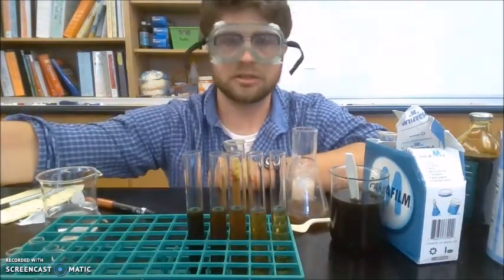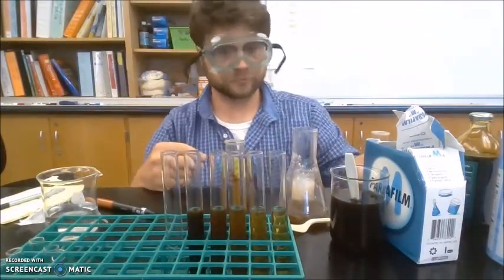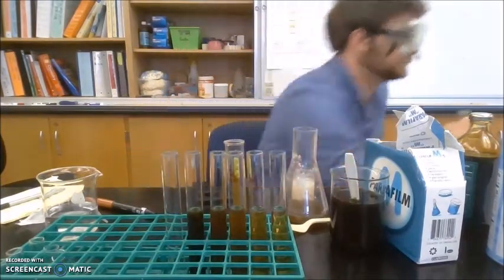And I actually am going to add a test tube. I'm going to rinse this out.